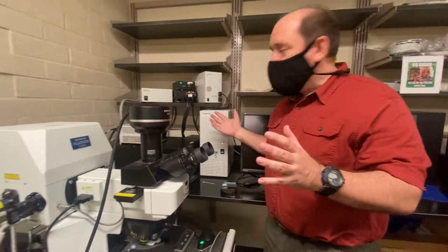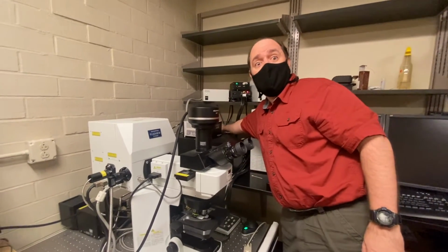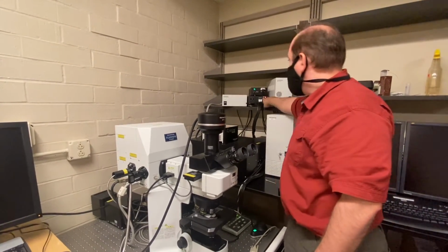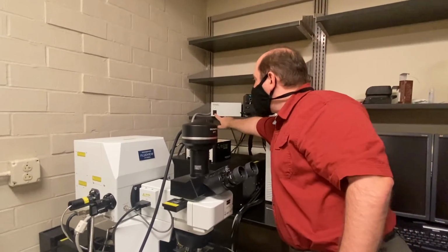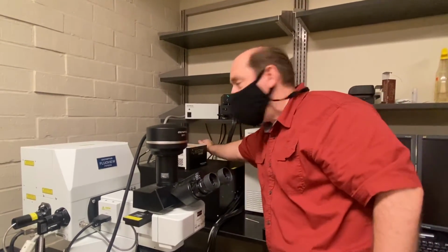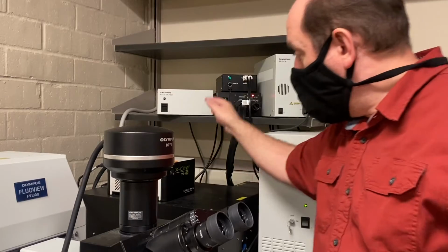But what about over here? Well, we've got lasers on, and lasers make a lot of heat. Oh, wow, that fan's blowing hot air now after using this for so long. Okay, so what I'm going to do first is I'm going to turn the hottest laser off with this key. I'm going to turn the next laser off, and our first laser off. So I turned the lasers off. What did I not turn off? The fan. This is the power for the fan. And the fan is still blowing to cool those lasers down.